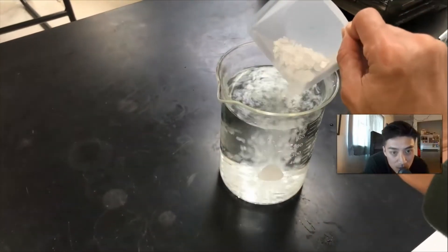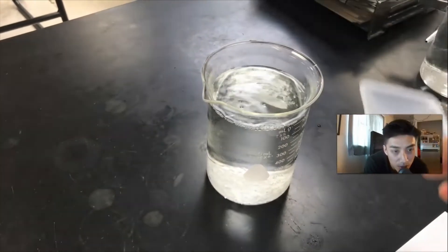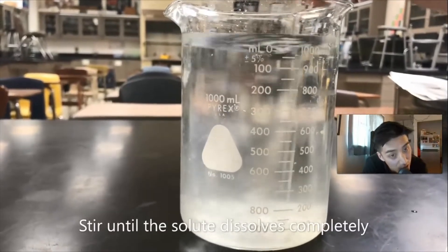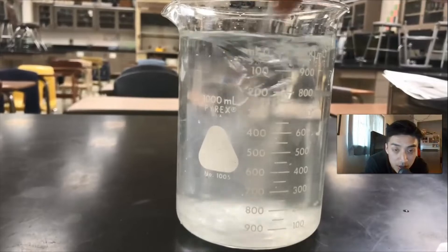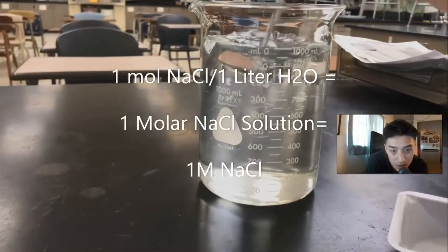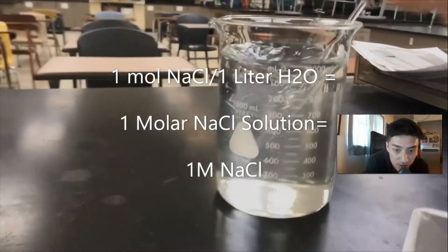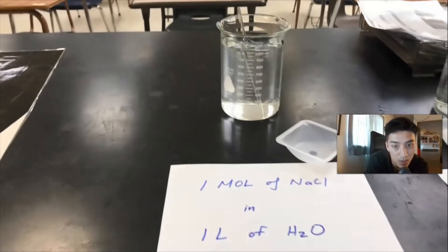If I want to make a one molar solution of salt, all I have to do is pour in the one mole of salt into one liter of water, then stir it until the salt completely dissolves. When it dissolves completely, I now have my new solution.